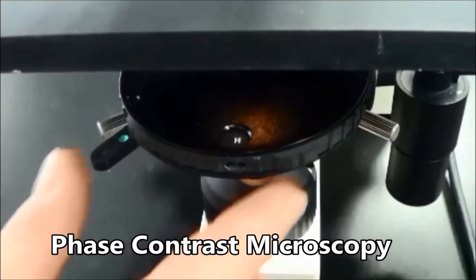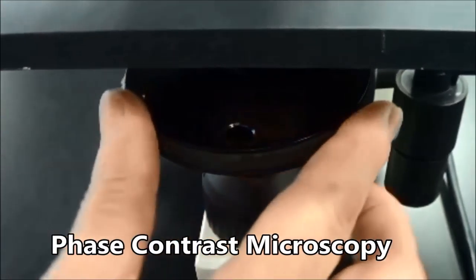Phase contrast microscopy: Set up the microscope as per the instructions for brightfield microscopy.